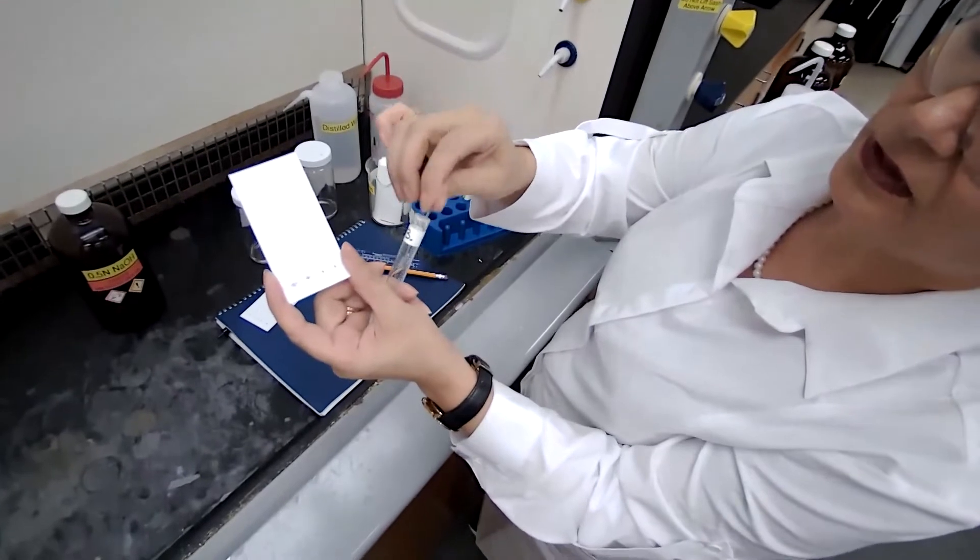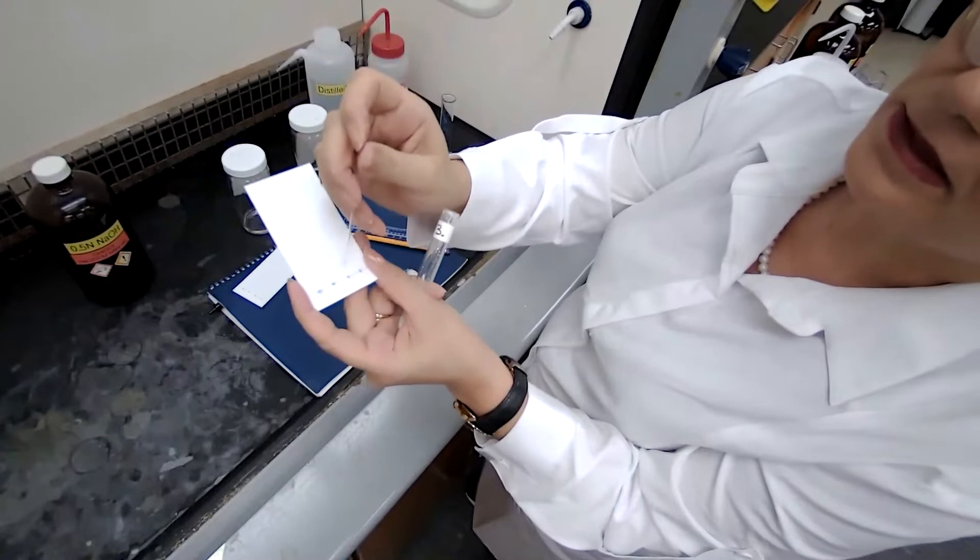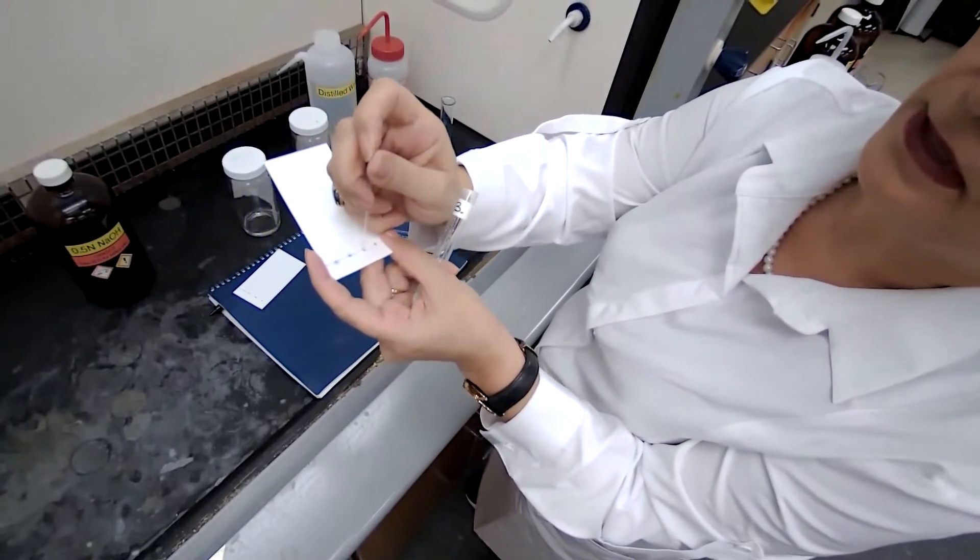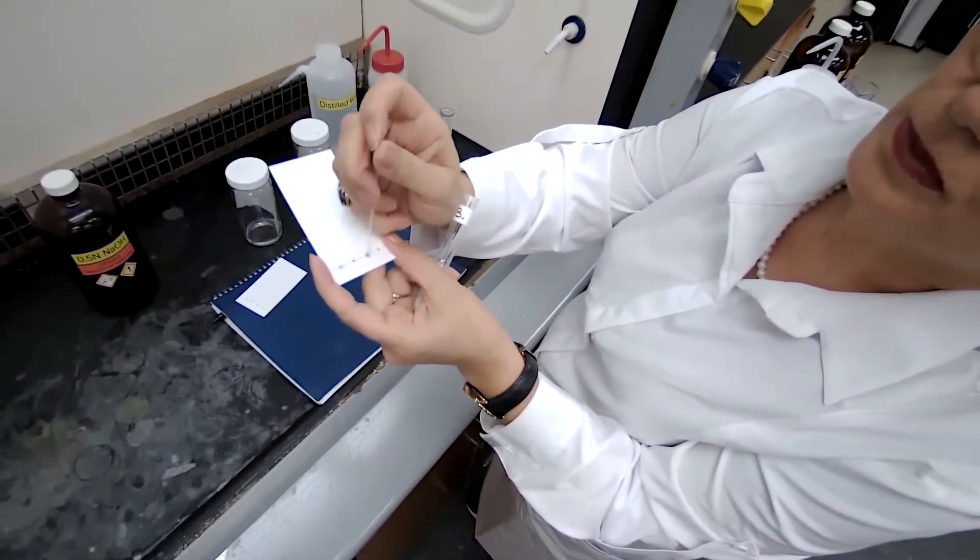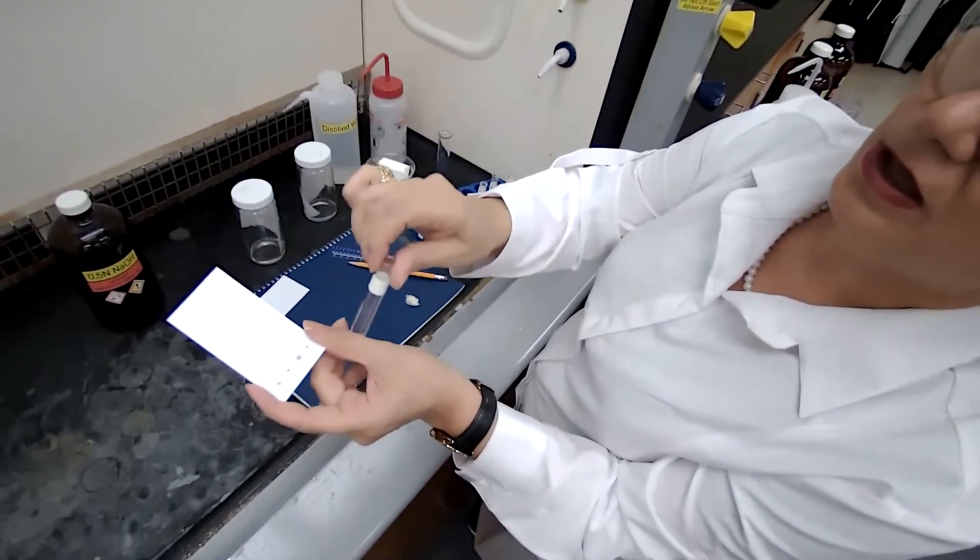I want to make sure that you could see it. What you could do, you can place that on the table and you just bring your capillary tube and spot. And the last one is our unknown.